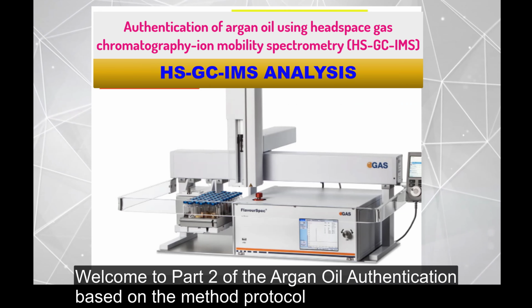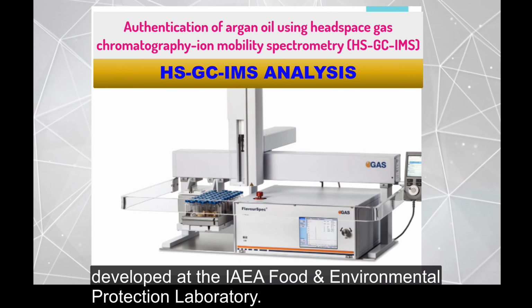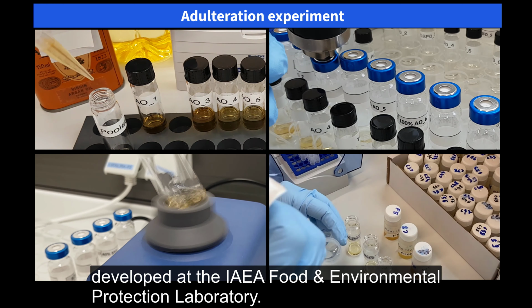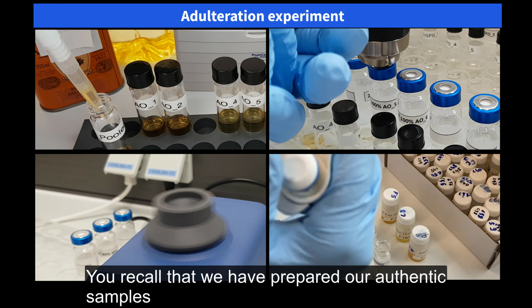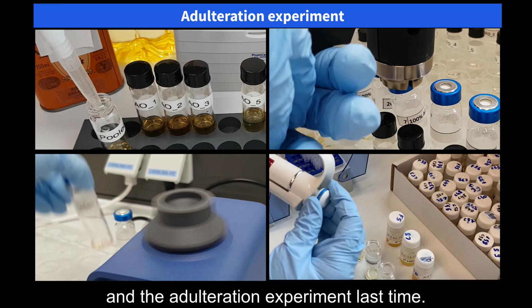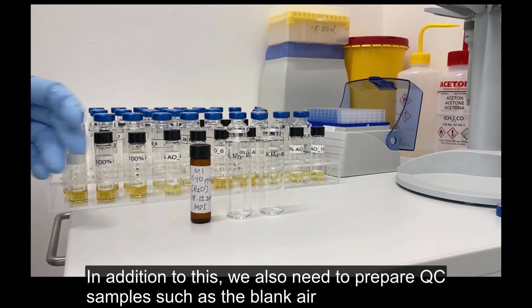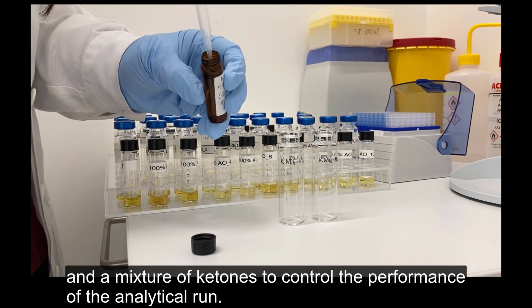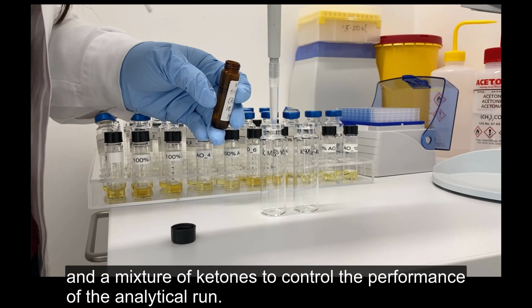Welcome to part 2 of the Argan oil authentication based on the method protocol developed at the IAEA Food and Environmental Protection Laboratory. You recall that we have prepared our authentic samples and the adulteration experiment last time. In addition to this, we also need to prepare QC samples such as the blank air and a mixture of ketones to control the performance of the analytical run.